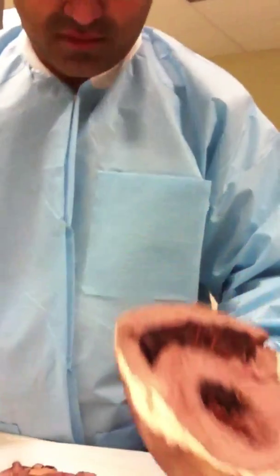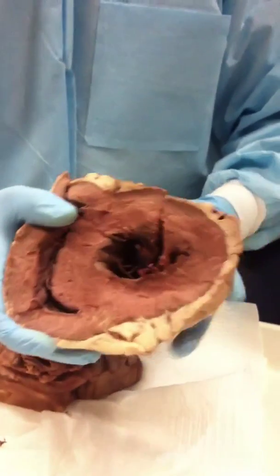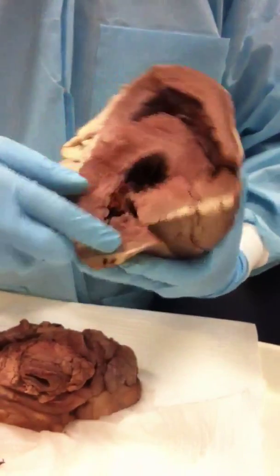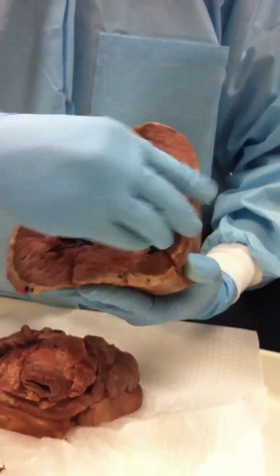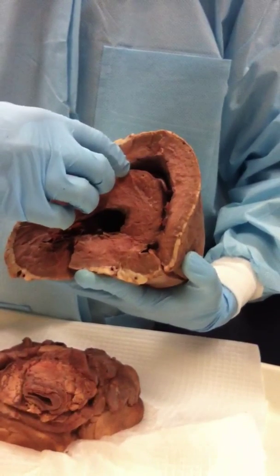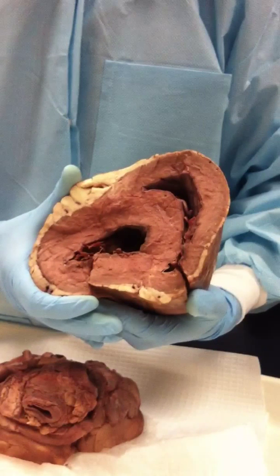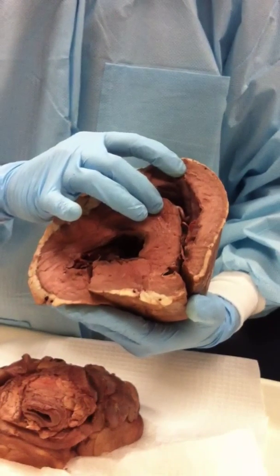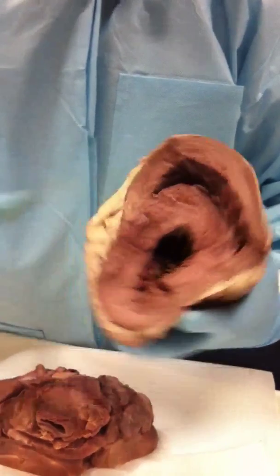Okay, so we got the second dissection of the cow heart. First thing you notice is the round nature of the ventricle here. That would be the left ventricle. And the right ventricle, you have more of a lunar or C shape. The left ventricle generates a lot more pressure as it squeezes blood out of the aorta than the right ventricle, which is squeezing and ejecting blood out into the lungs through the pulmonary valve.